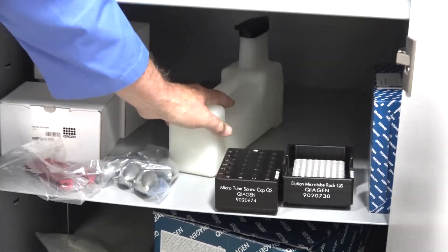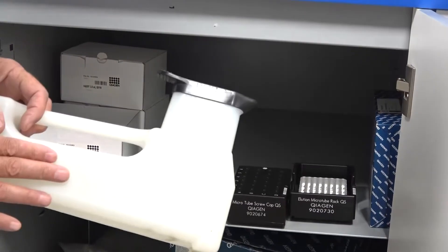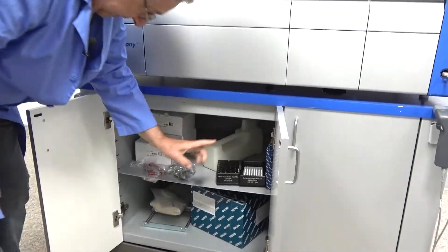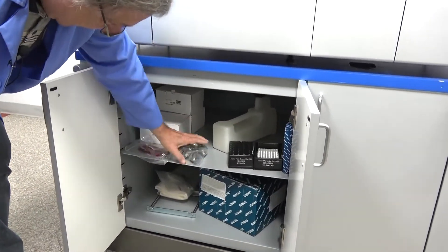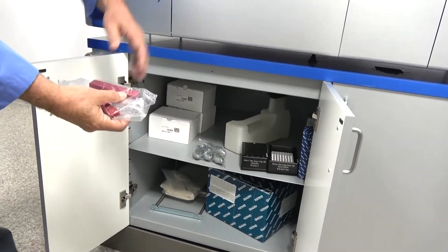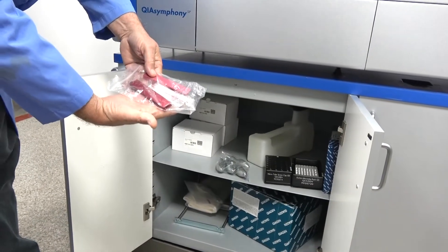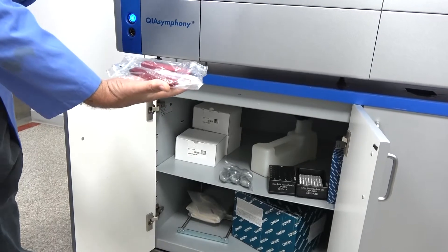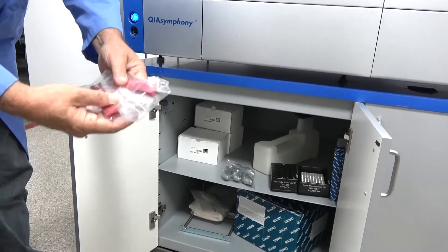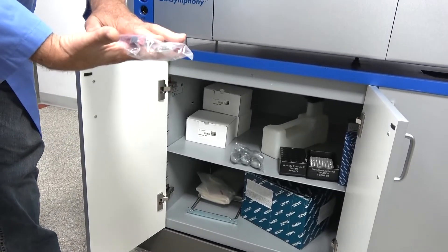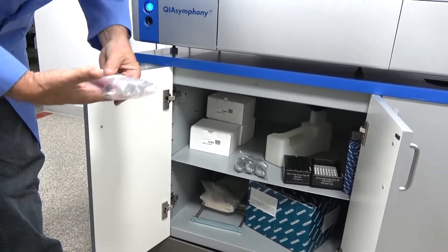These are the cold plate units. They go on the cold racks in there. You want to make sure that it comes with a waste bin such as that. They can come with one, they can come with two. We always try to sell ours with at least one. Lifting handles are real handy to have. Make sure that they tell you they're going to secure that arm. The company does make shipping blocks so that the arm is fastened in shipping so it can't bang around and basically hurt itself. There are other ways to secure those, but those are the simplest and easiest.